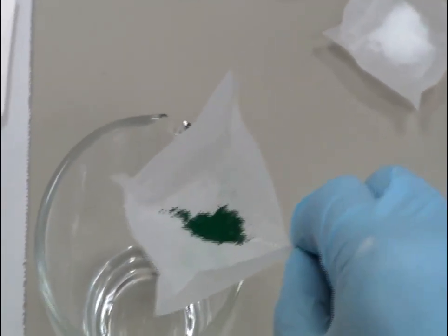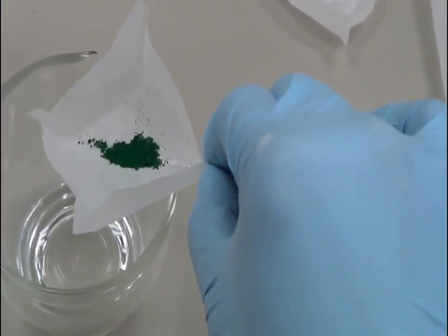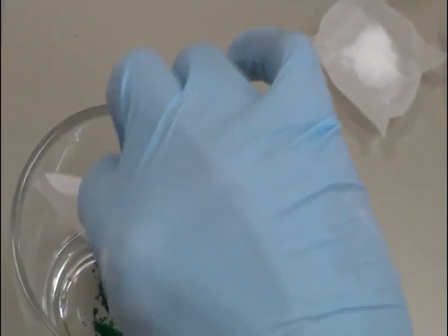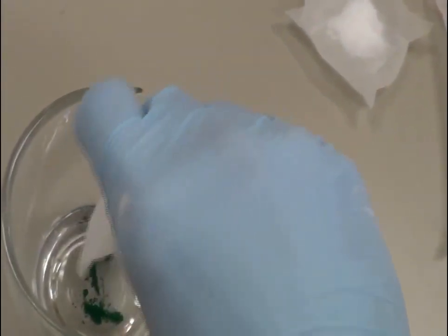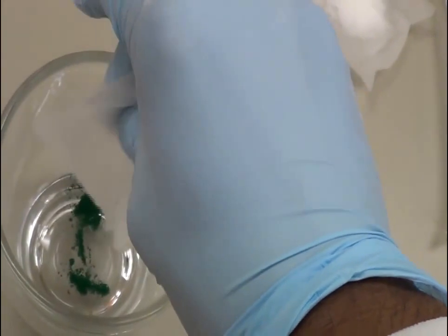The first step is to take this mortar. We are going to presume this food color is the drug, because we want to show you how to homogeneously mix the drug with other inactive ingredients. So let's presume this food color is the drug.